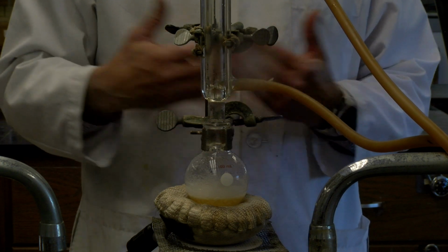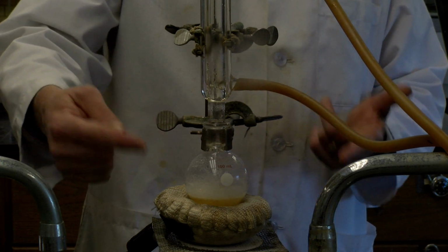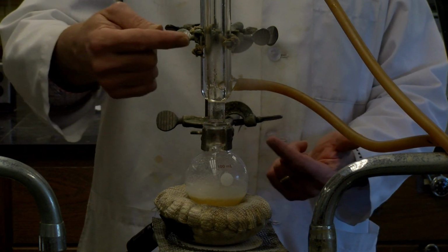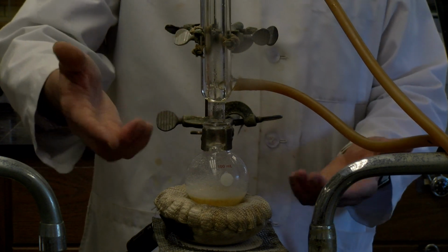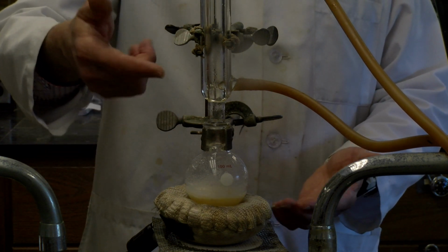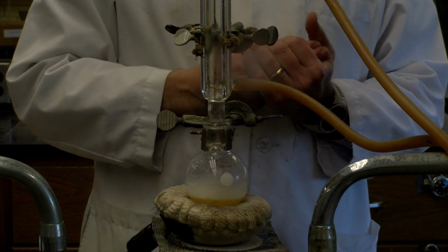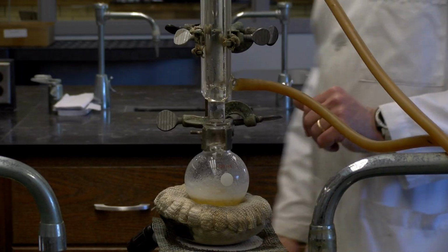All right, so that's similar to what's happening here in reflux, is that we're getting a high temperature. You notice some popping, and that's again because the solution's heating up. But ultimately the water and the HCl and the other things that are in here, even the products, they're not actually heating up and going away. All right, so we're going to let this go for the 10 to 15 minutes that it talks about and be back to finish it up.